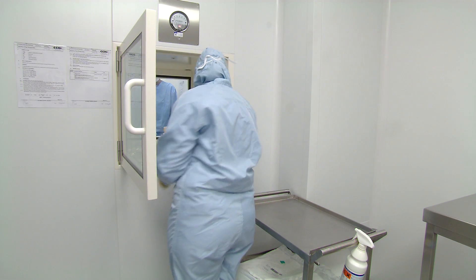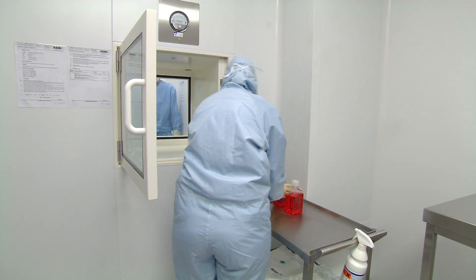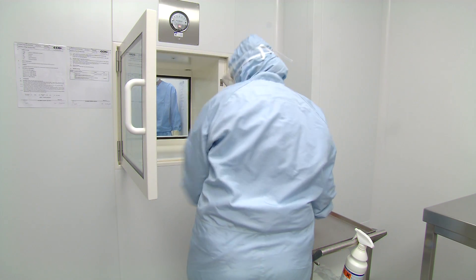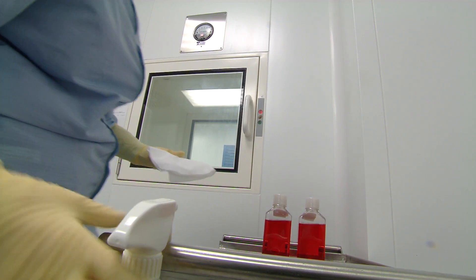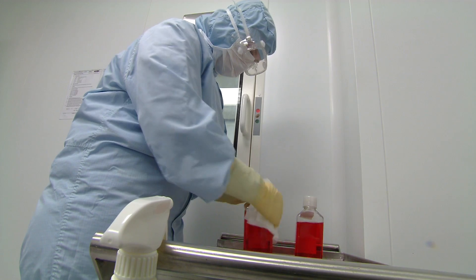A clean room is an area which has a very, very low level of particulates, and particulates can either be viable or non-viable. Viable particulates are bacteria, yeast and moulds, and non-viable particulates are pieces of dust or debris. A clean room has classified areas working out from grade A, B, C and D. In grade A, for example, you're only allowed 100 particulates in total per cubic foot.